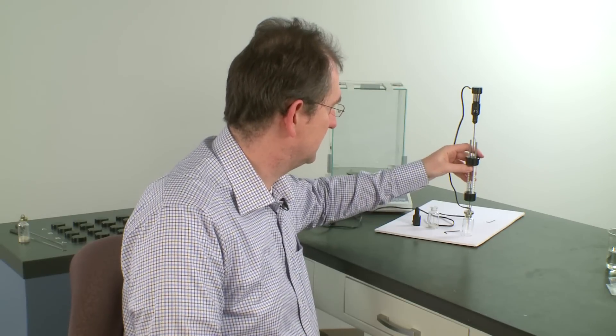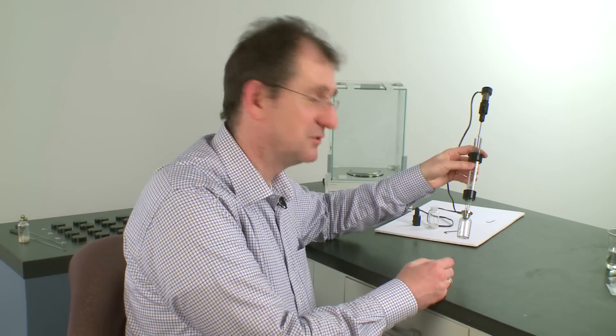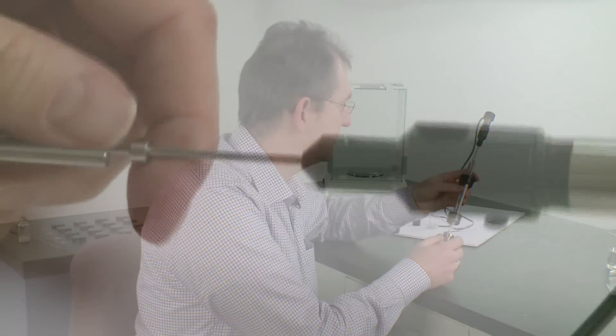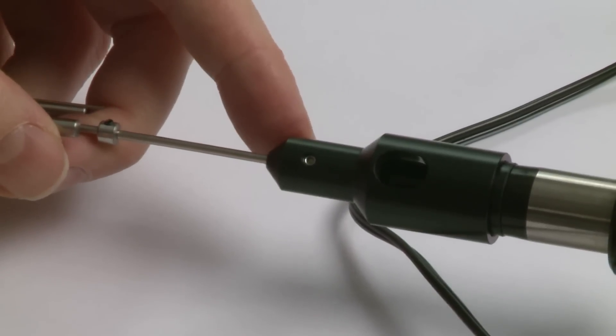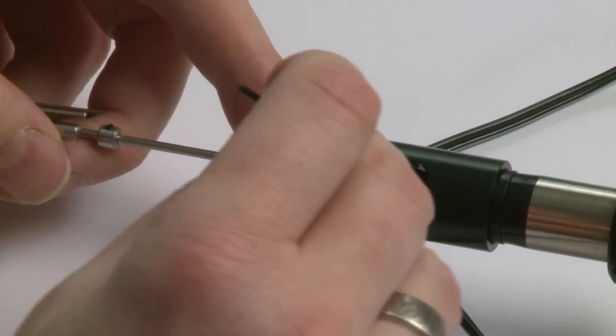We recommend to do the adjustment in a sitting position since these tiny screws you have to remove tend to get lost.